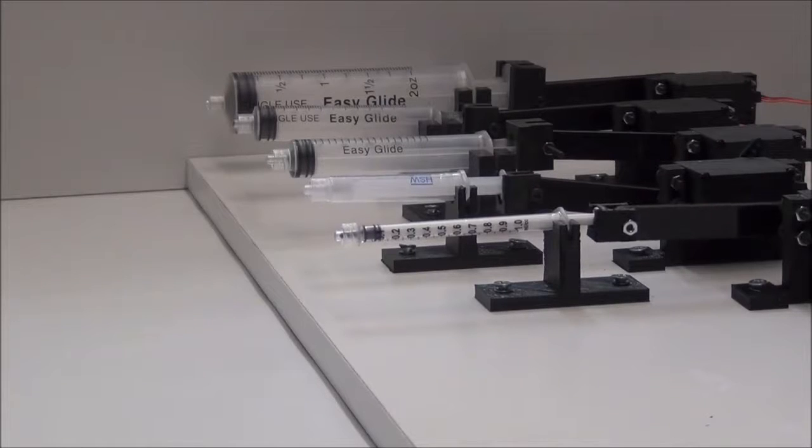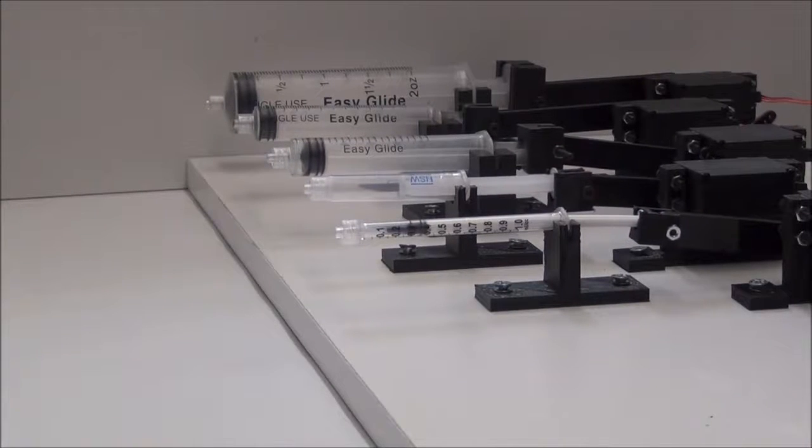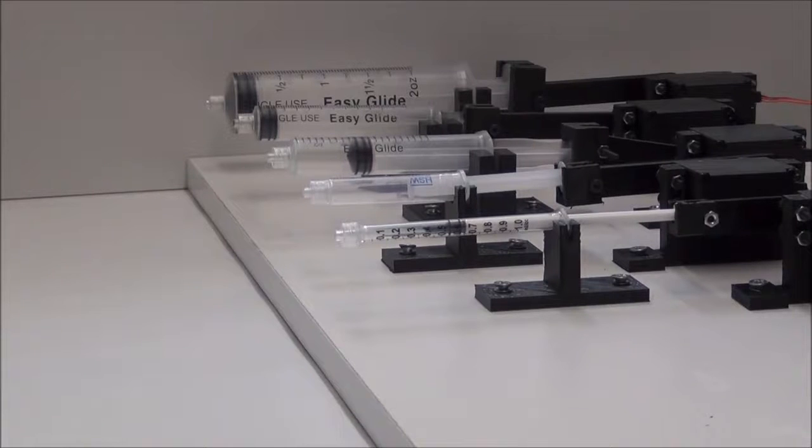Ranging from 2 valves and 1 fluid controller to hundreds of both, Neptune can handle the job with only one Arduino. The baseboard is compatible with an emerging standard in microfluidics that is modular and expandable, expanding the reach of a desktop CNC into what typically requires a full machine shop.